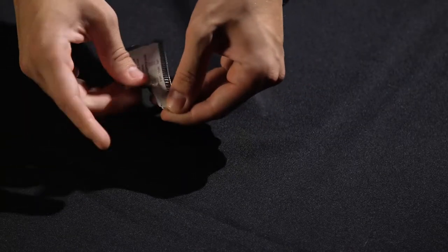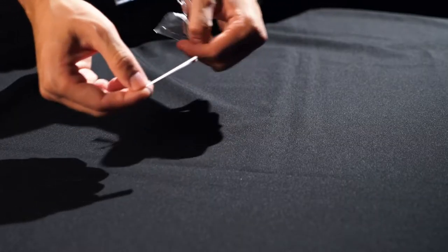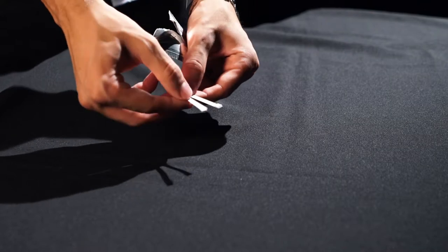When opening your test strip package, be sure to tear the foil carefully because your color chart is located on the package.